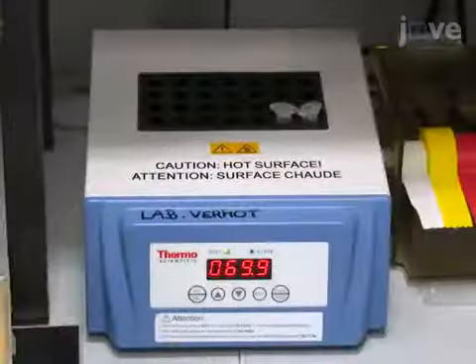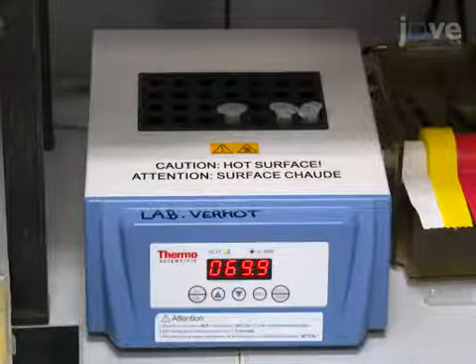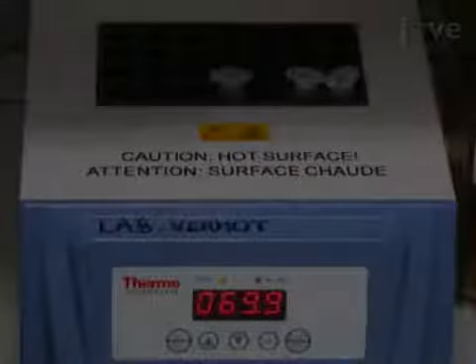In the meantime, melt a 1 milliliter aliquot of 0.7% low melting point or LMP agarose by placing the tube in a 70 degrees Celsius heat block for about 5 minutes.